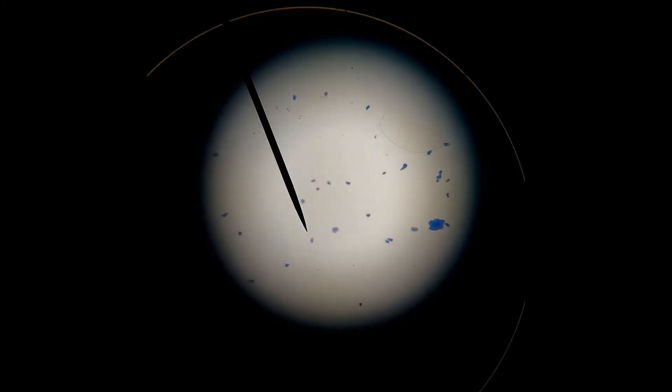I have now seen quite a few cells I'm going to center this cell in there and then change to a more higher magnification.